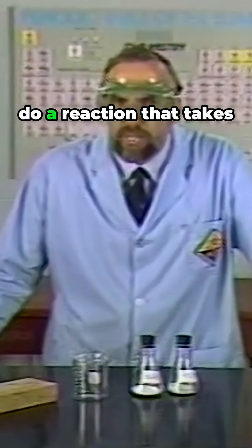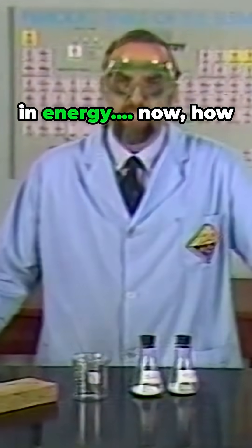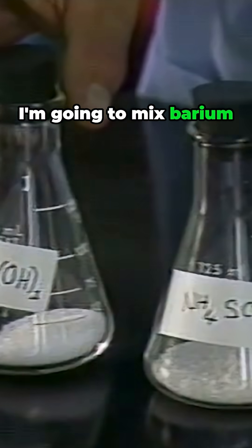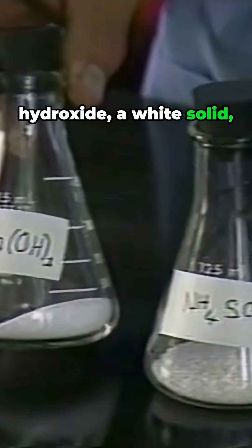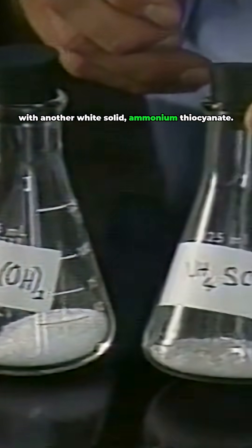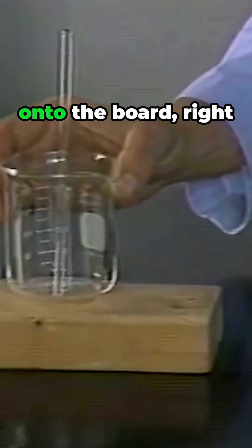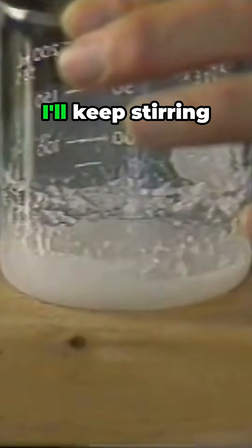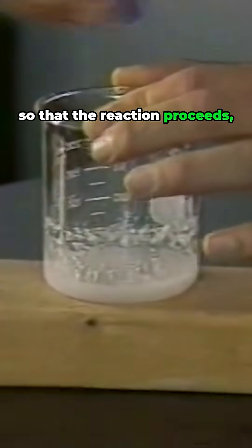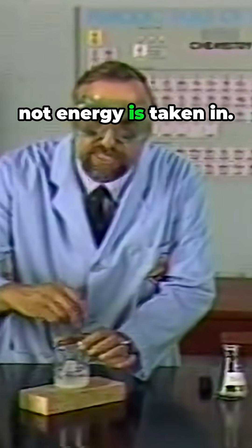This time, I want to do a reaction that takes in energy. Now, how are we going to see that? I'm going to mix barium hydroxide, a white solid, with another white solid, ammonium thiocyanate. Put the beaker onto the board right on top of that water. I'll keep stirring so that the reaction proceeds, and we'll see if we can tell whether or not energy is taken in.